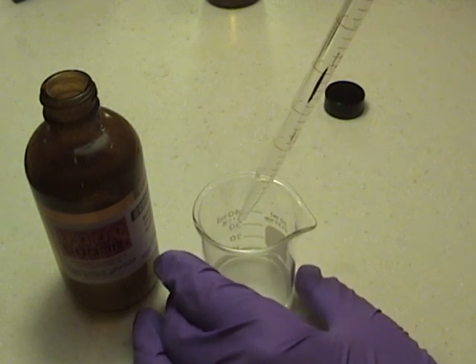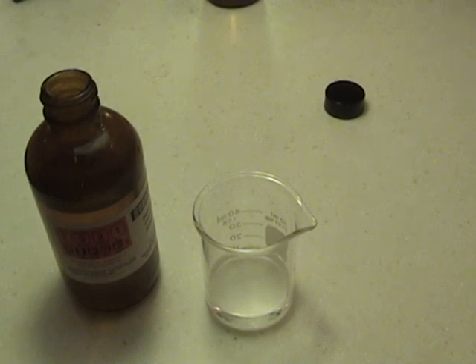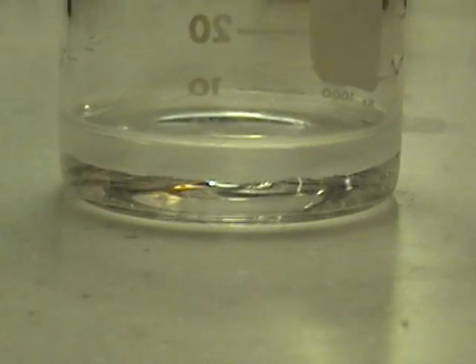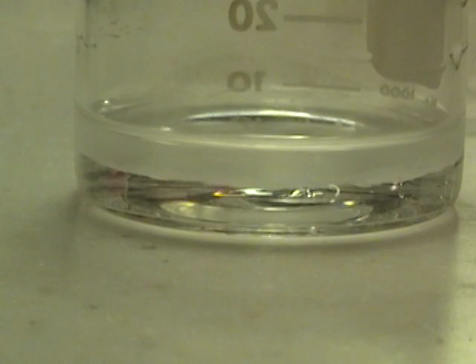You want to make sure you put it down very carefully and make sure the chemicals do not mix or the experiment will be ruined. You can see there is a very fine layer of the nylon there and you can see where the two liquids meet.